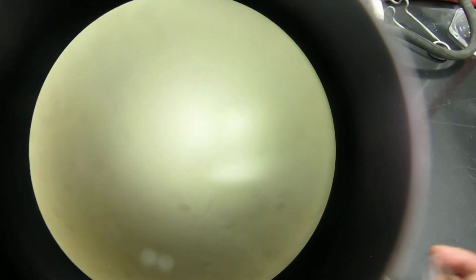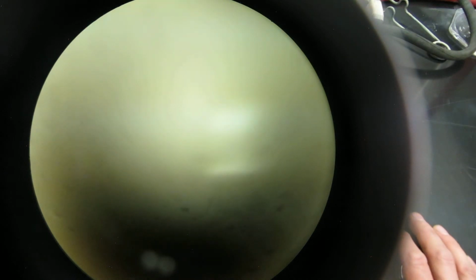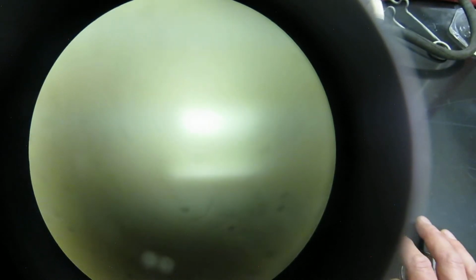Again, this is bacteria that's grown from the Santa Monica urban runoff recycling facility, and I got this water from the influent, so the water before it hit the plant, and this was during a rain event, so there's a lot of sediment coming down in the urban runoff. So that's what I wanted to show you with this video.